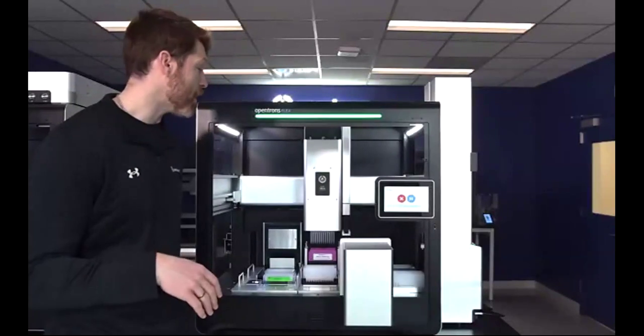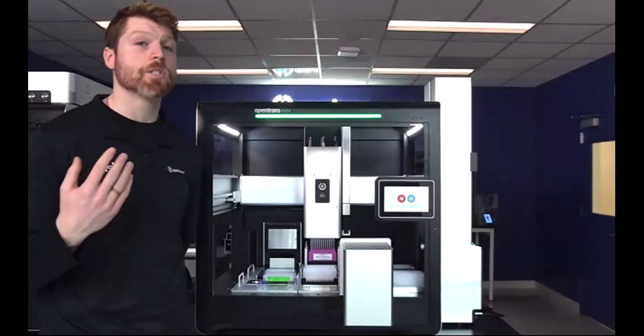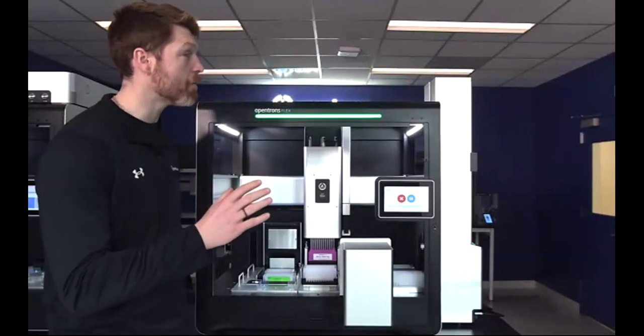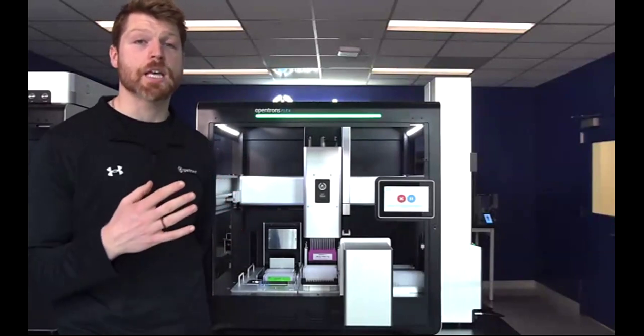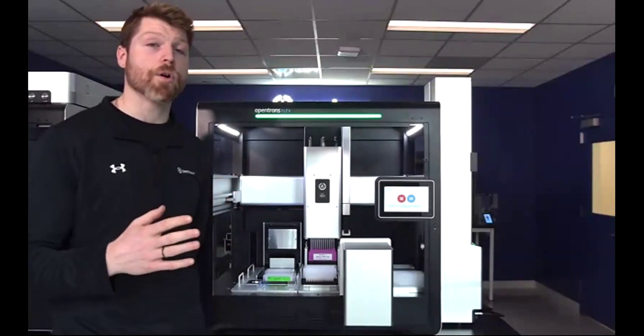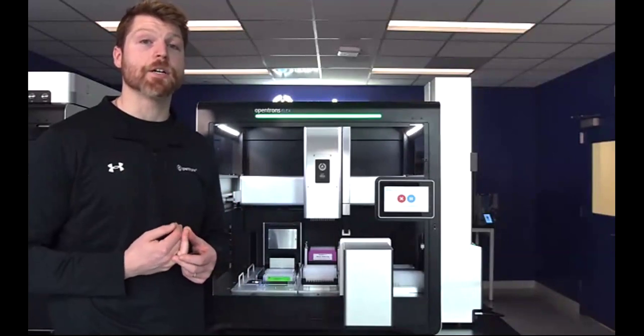Throughout the protocol, you have the ability to do things such as pause the stacker and empty it or refill it. So as I mentioned, you can fit 6 tip racks into the stacker and 1 in this accessory position, giving you 7 extra tip racks. If you needed more than that, you could either scale up to have multiple stackers, or you can inject pause steps into your protocol that will allow the stacker to replenish the overall amount of tips within it.